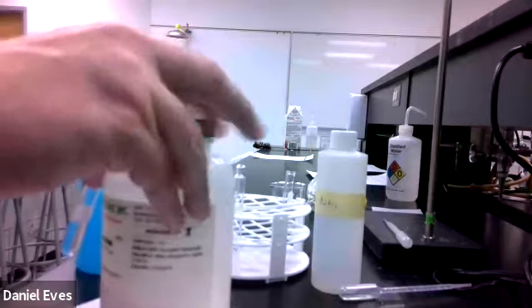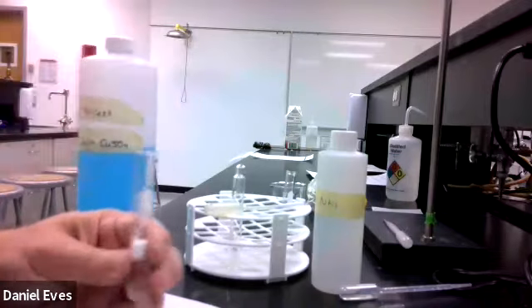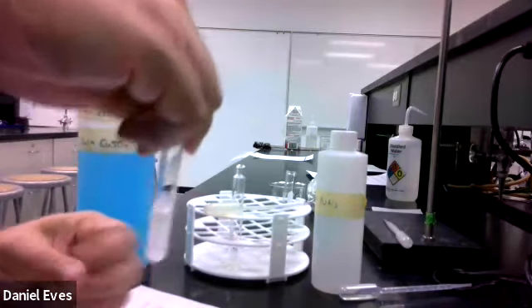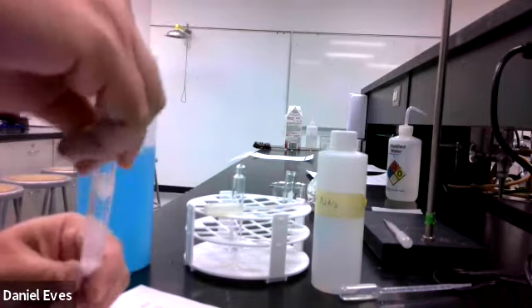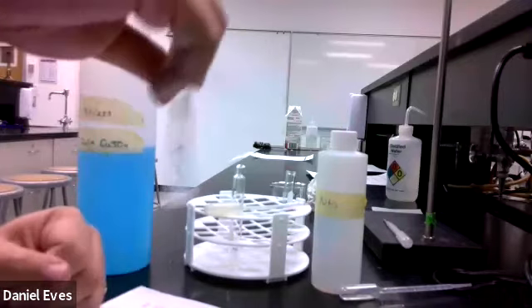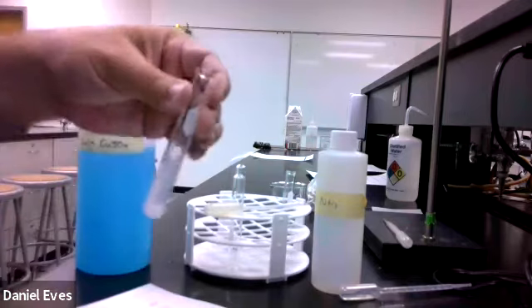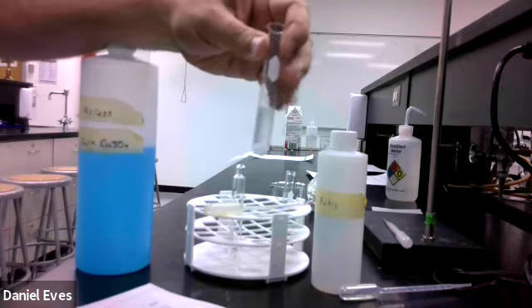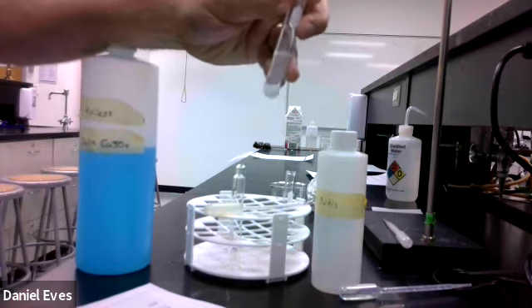What I'm hoping to make here is a saturated solution. So I'm going to agitate this the best that I can to try and dissolve my ammonium chloride. I want to have all of the solid dissolving as best I can. Now I'm feeling this because I know that there's a temperature change involved, and this is getting cold. So this should tell us that the solution process is endothermic. That means that the energy it takes to disrupt the water and the ammonium chloride is more than we get from mixing ammonium chloride with the water.